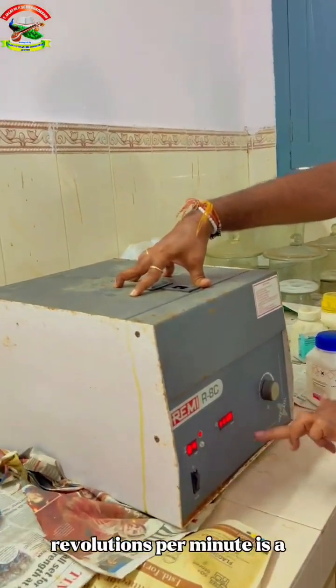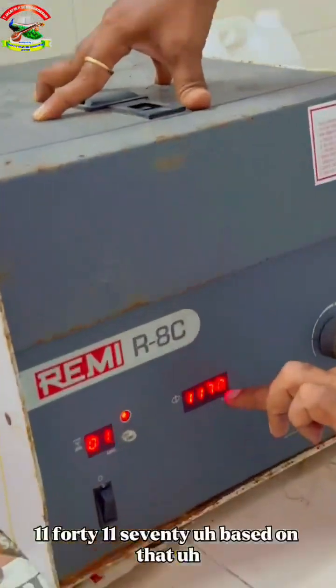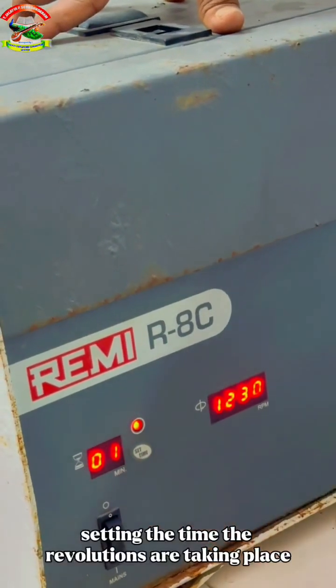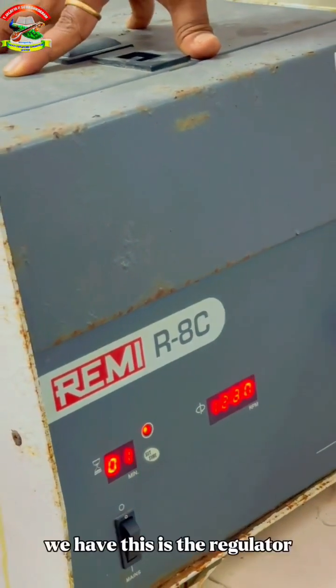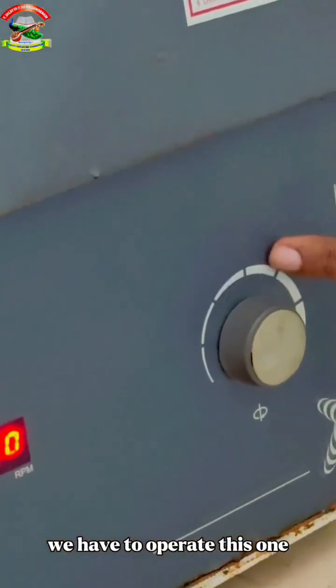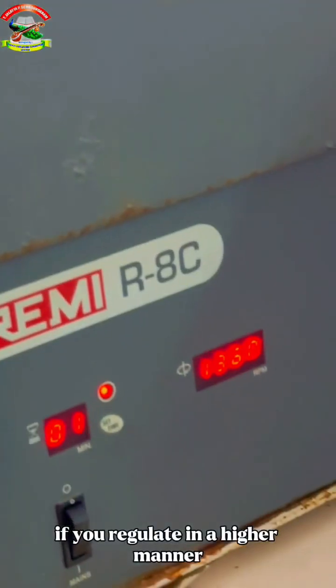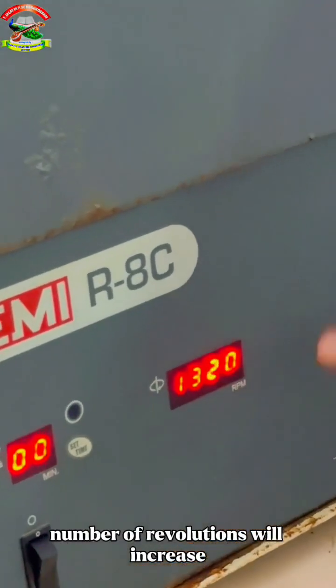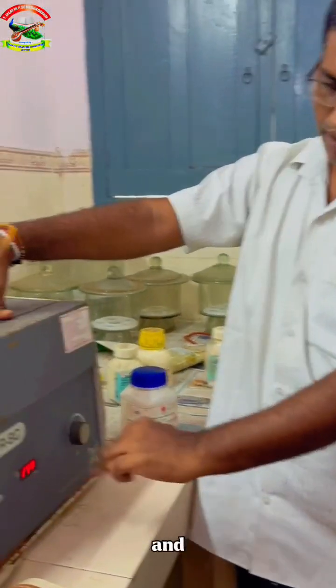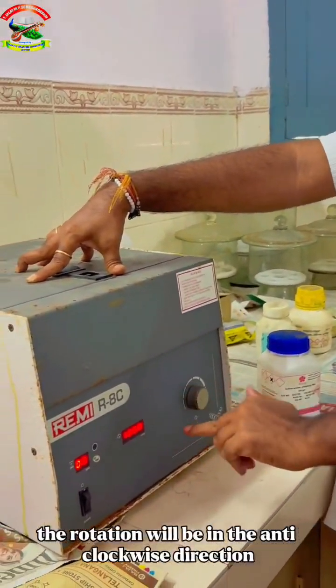Revolutions per minute is 1140, 1170. Based on that, setting the time, the revolutions are taking place. This is the regulator. If you want more revolutions, we have to operate this one and regulate it. If you regulate in a higher manner, the number of revolutions will increase. The 1 minute time is over, and the rotation is in the anti-clockwise direction.